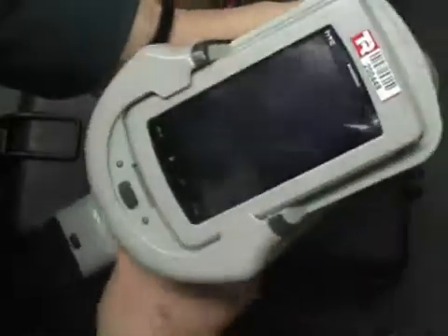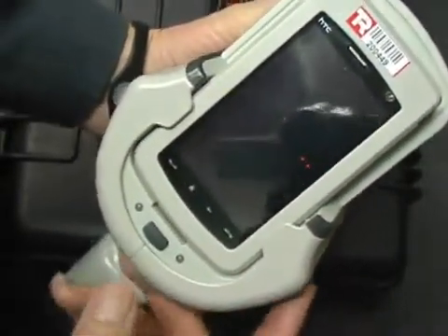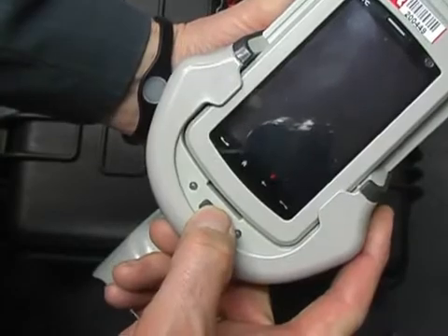Note that the PDA also needs to be charged up occasionally. If you're using it over a day, the battery in this does last around a day. Having inserted the battery, we now need to turn the instrument on.